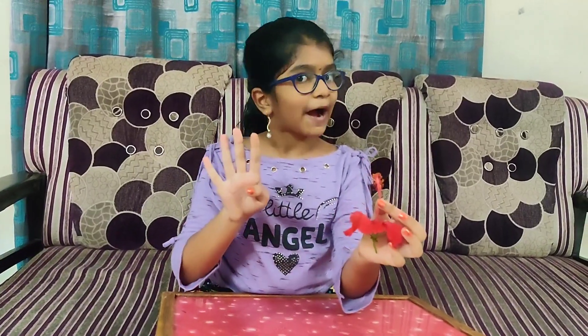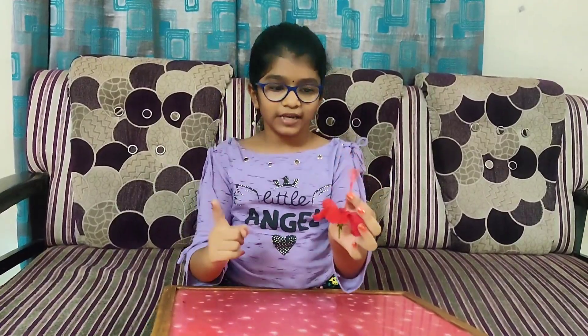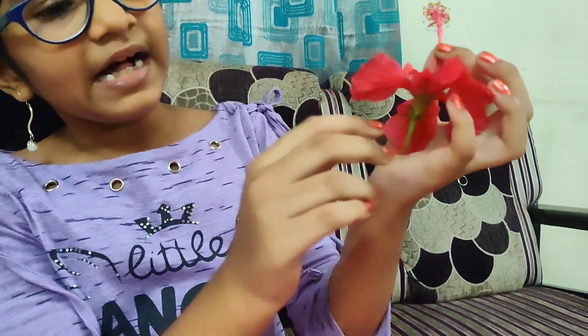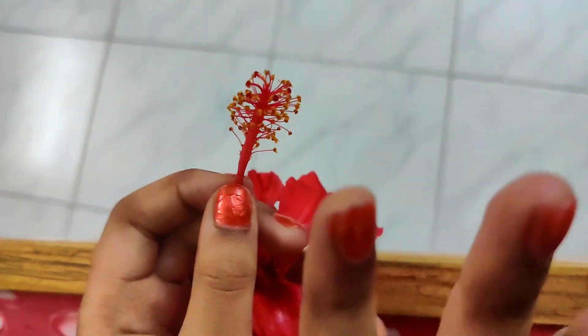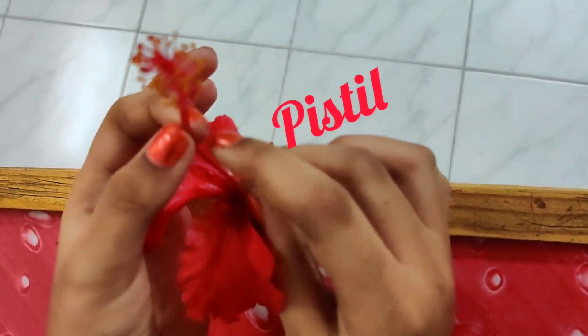A flower has four parts, which are called four whorls. The first whorl is sepal — this is sepal. The second whorl is petal — this is petal. The third whorl is stamen — this is stamen. And the fourth whorl is pistil — this is pistil.